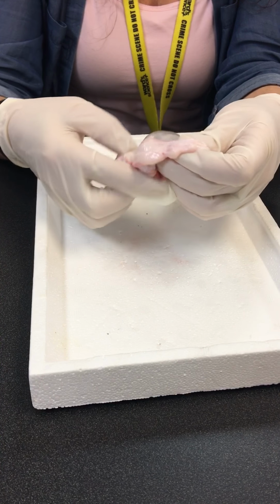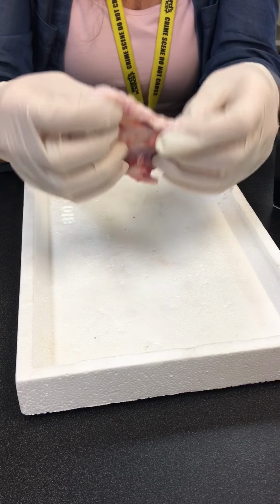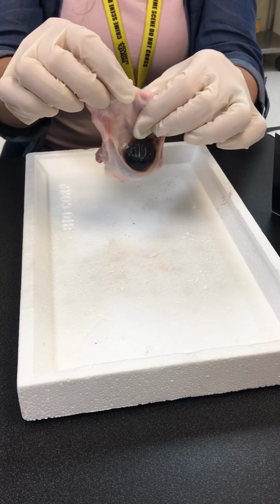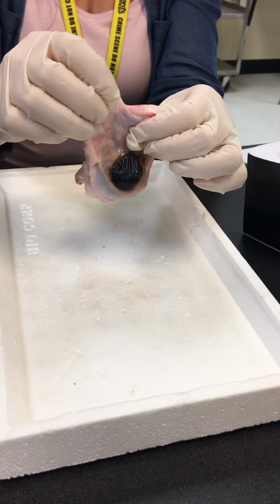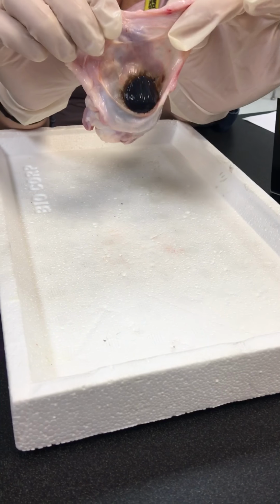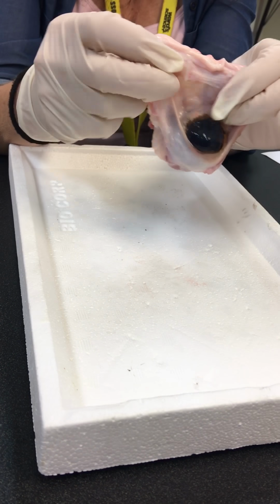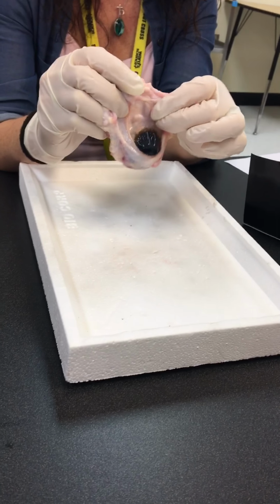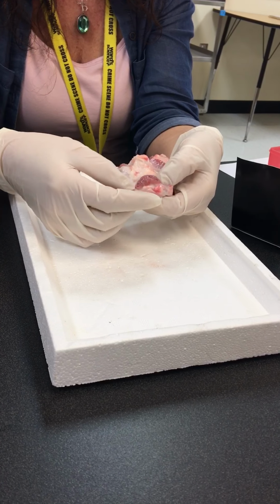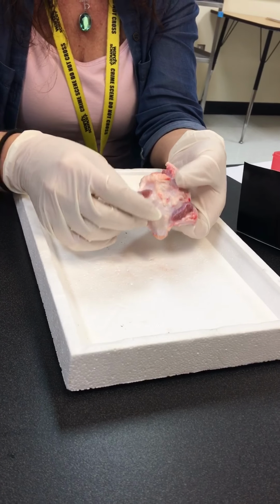Now you notice there's a lot of fatty and connective tissue around here. You see this fatty and connective tissue? This exists in a bony socket, so this helps cushion and fill that space. On this back side, they've cut these pretty close. They didn't leave much muscle, but you can see certain eye muscles. These are the extrinsic muscles here.